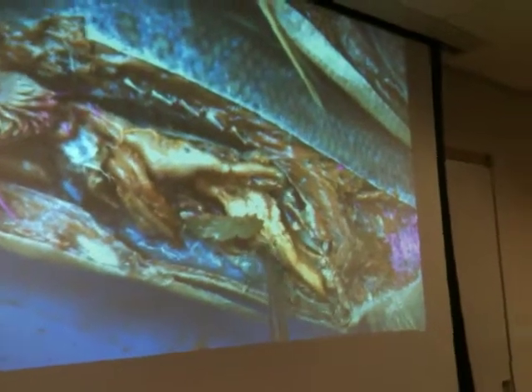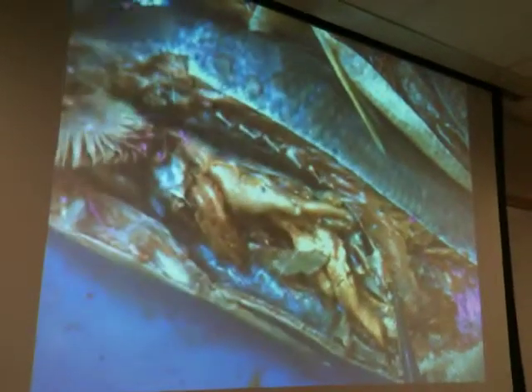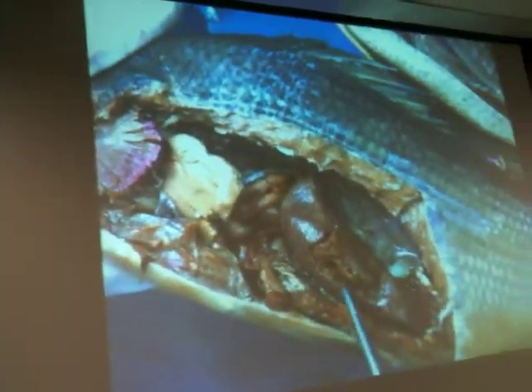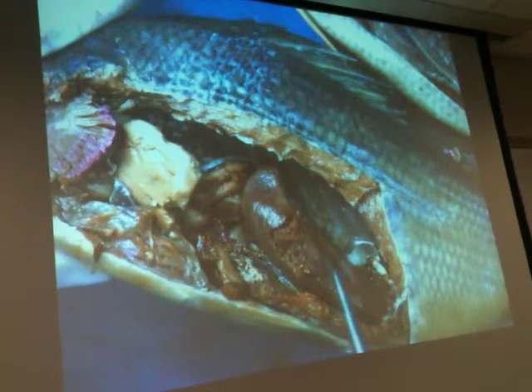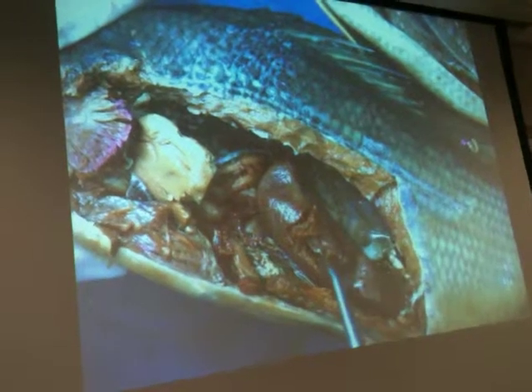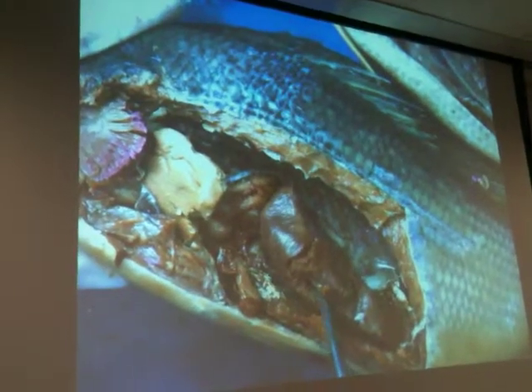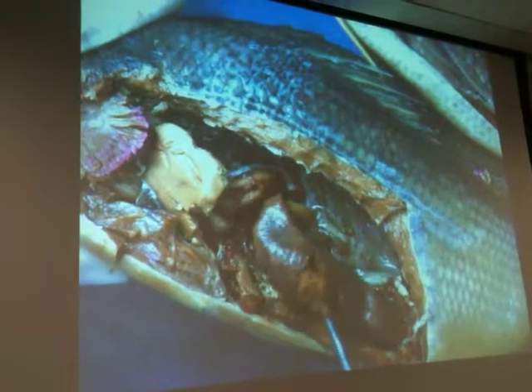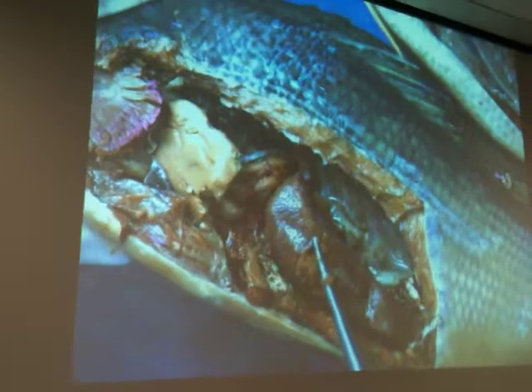Okay. A lot of you guys probably found fish with big, giant ovaries. Okay, here's the ovary on this fish. That's covering a lot of the intestines. And how you tell it's an ovary is if you stick your probe into it, and if inside it looks really granular, okay, then you know it's an ovary.